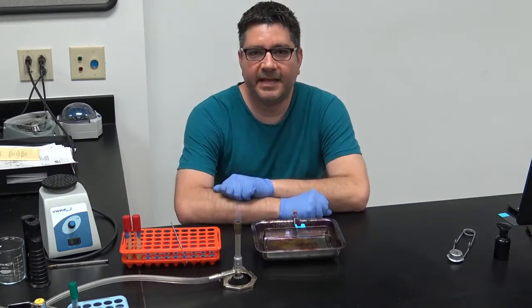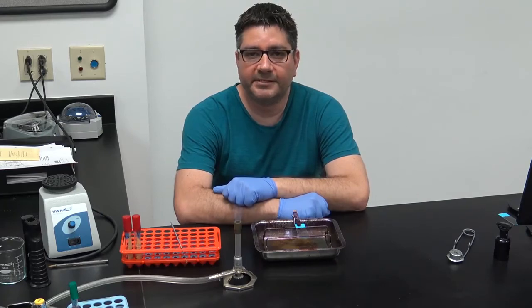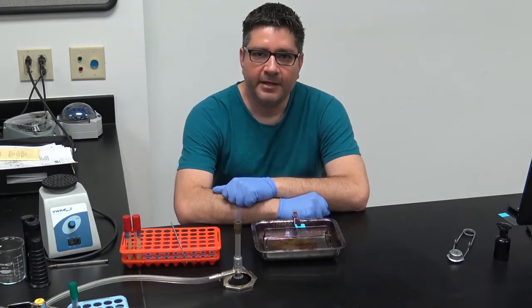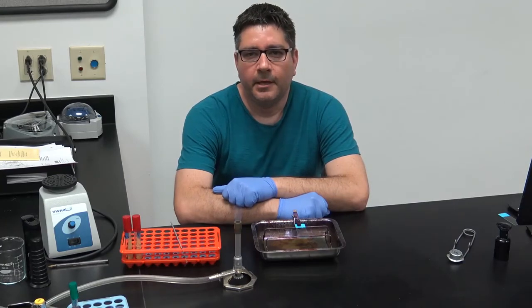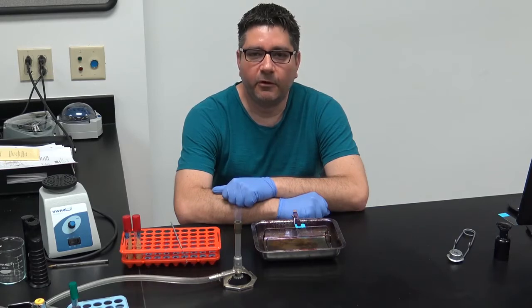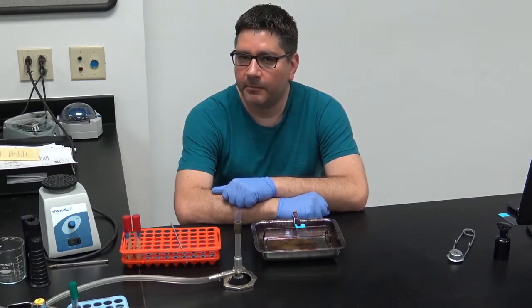The acid-fast stain is another differential staining technique used to distinguish organisms with a waxy outer layer. The layer, mycolic acid, prevents other staining procedures from working by not allowing for the decolorization following a wash with acid alcohol. The genus that this is used on is Mycobacterium. For you to remember easily, Mycobacterium contains mycolic acid, myco.